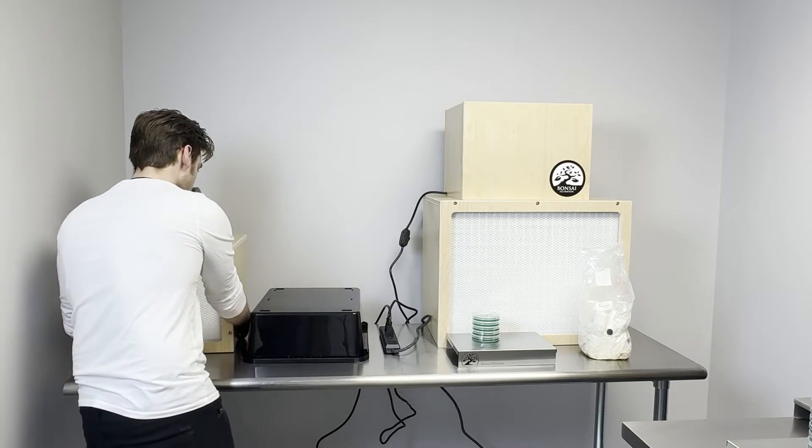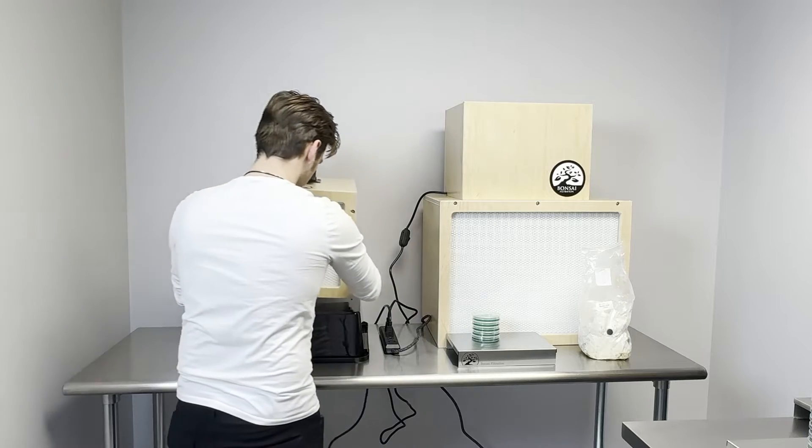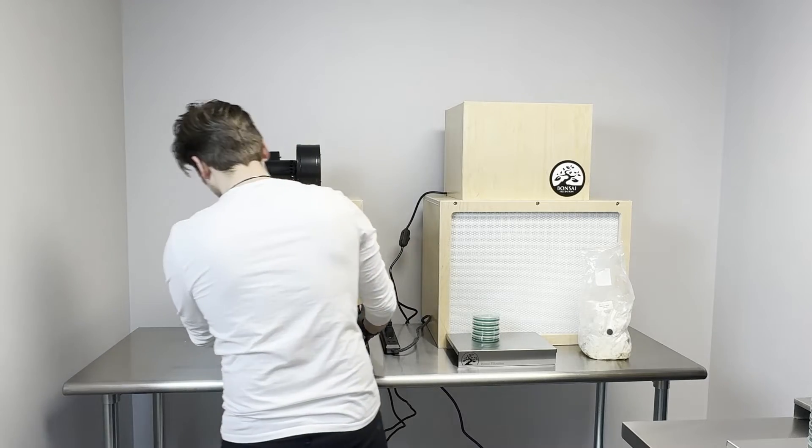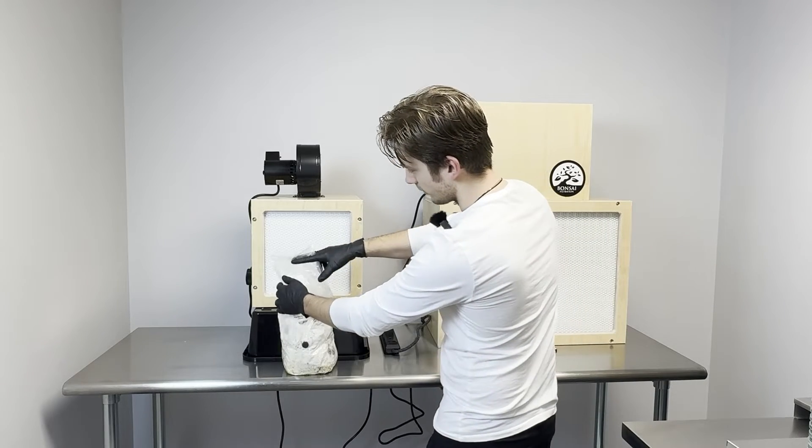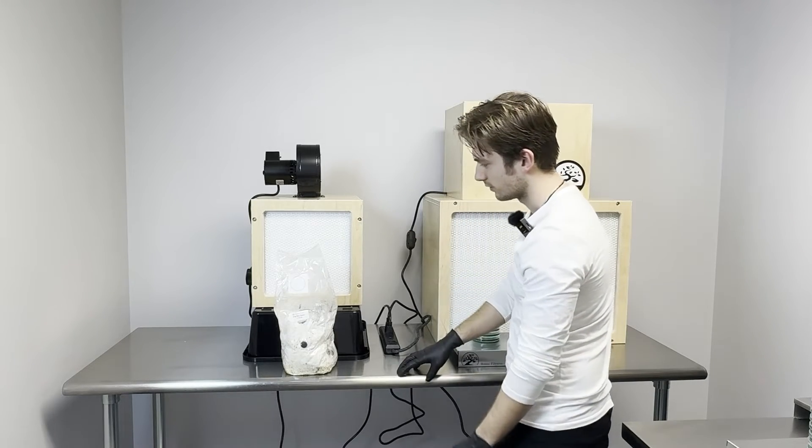Just kind of give it a little bit more space to work with, and as you can see once you cut open that bag it's still going to be within the flow.